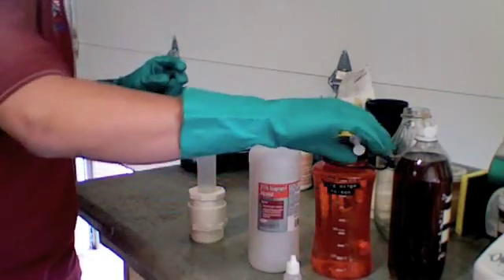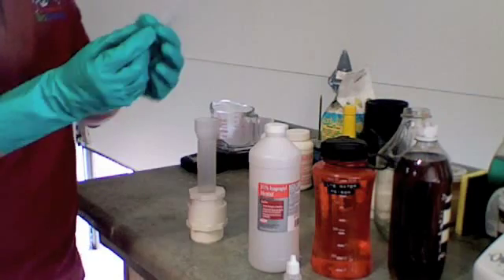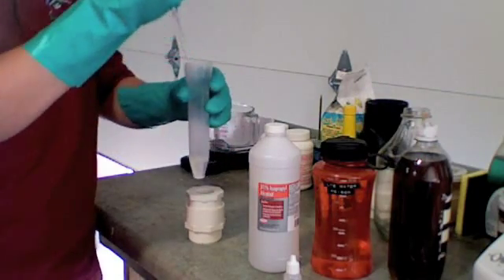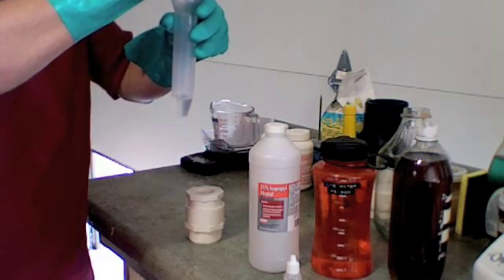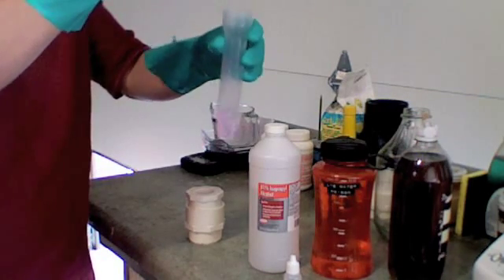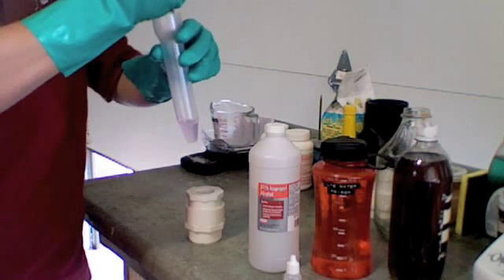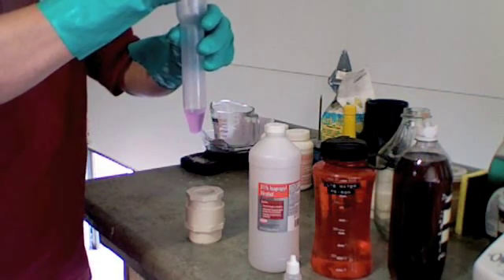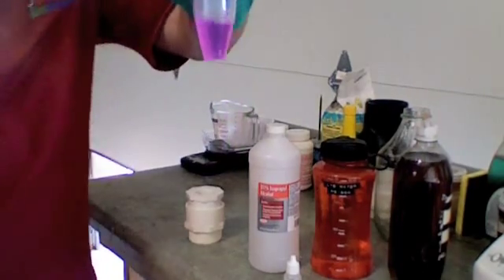The third step, take lye water. Add one drop at a time until it turns pink. This is canceling out any acids that are in the alcohol. Notice the pink color.